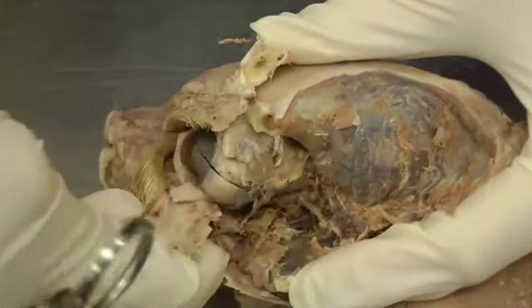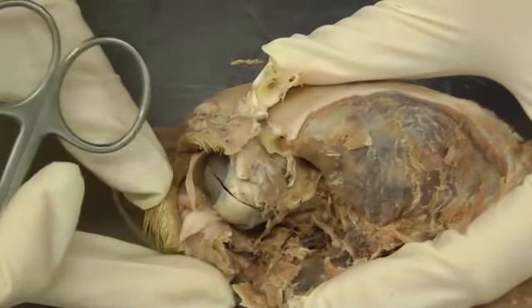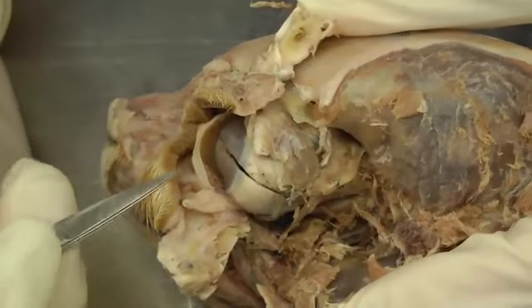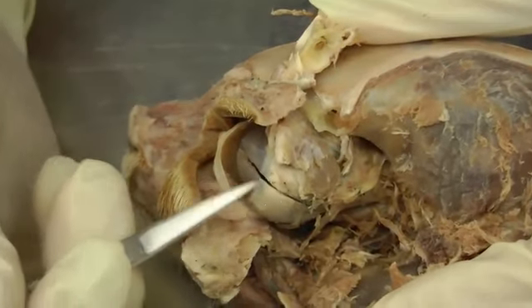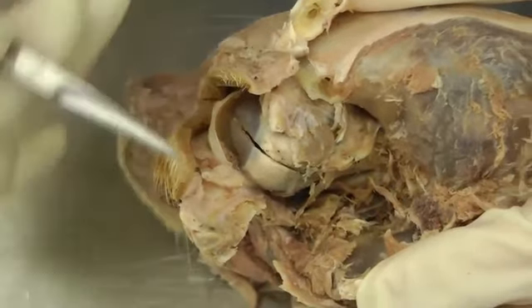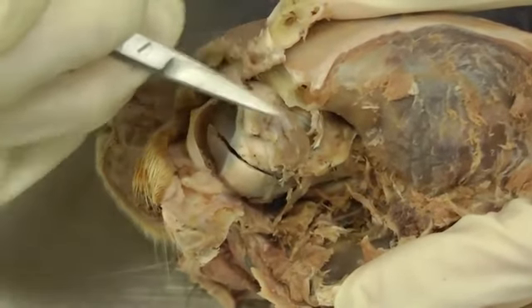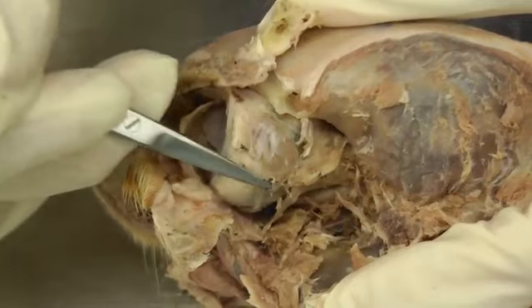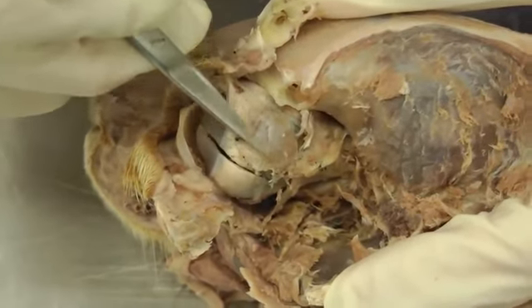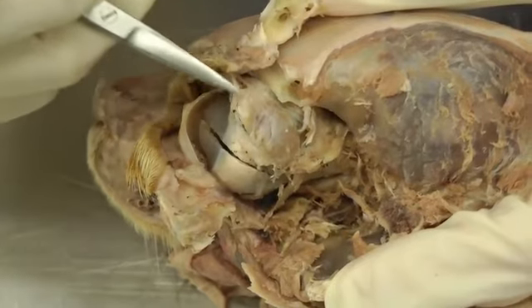And then I also reflect this part down there. So then you can see all of these areas. You're also going to cut the lateral commissure on your eye here, and then you can open that up even further. So underneath your orbital ligament and your orbit here, you're looking for the lacrimal gland, which is this flat, tannish, lobular tissue right here.